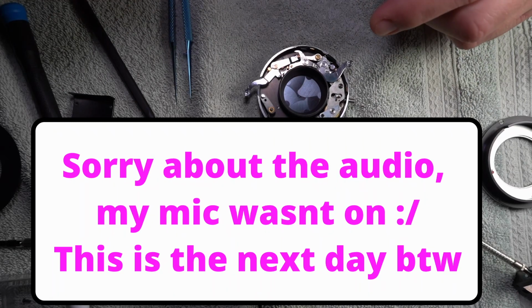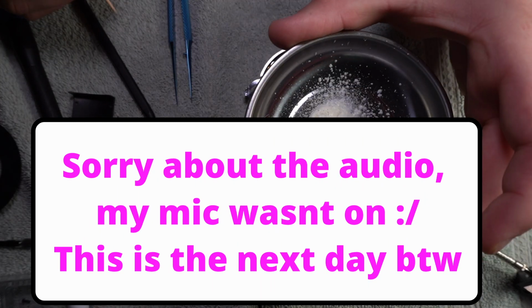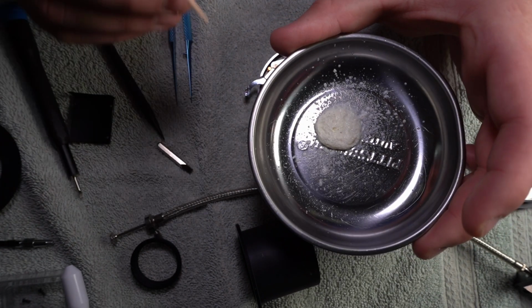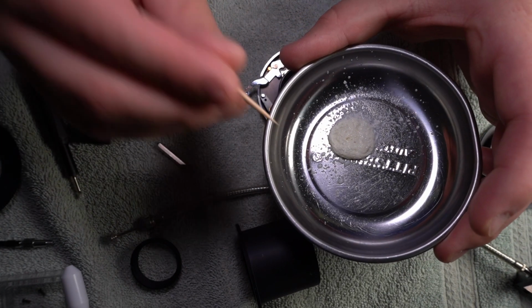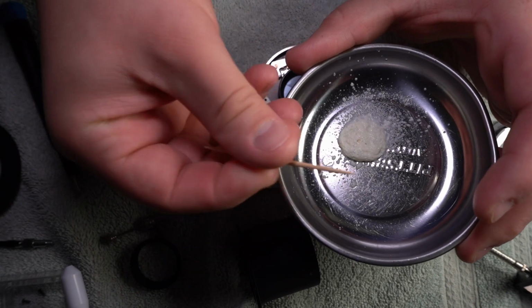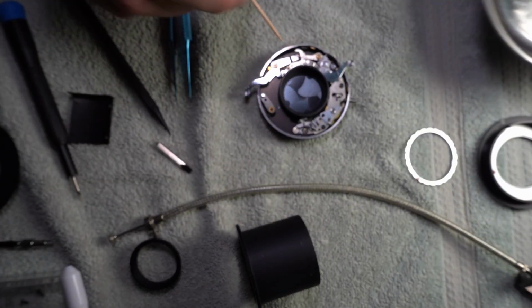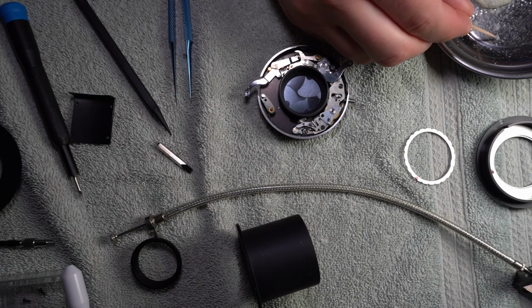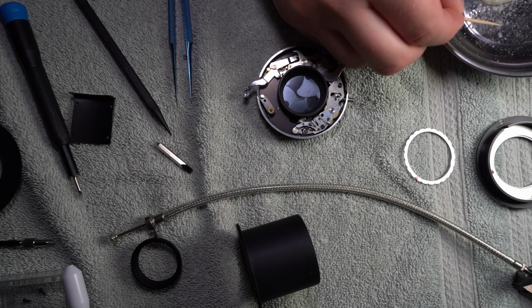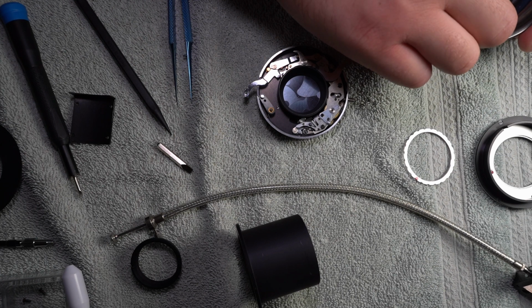I'm going to now lubricate that little thing, and I've got some white lithium grease here, and I'm going to get it on the end of a toothpick, hopefully, and then get it in there somehow. And I'm just wanting the tiniest amount of the stuff.